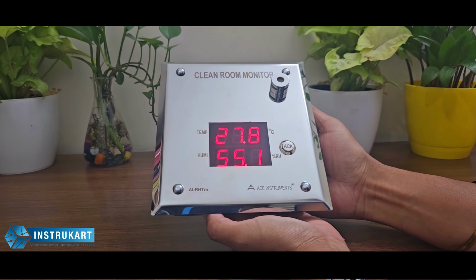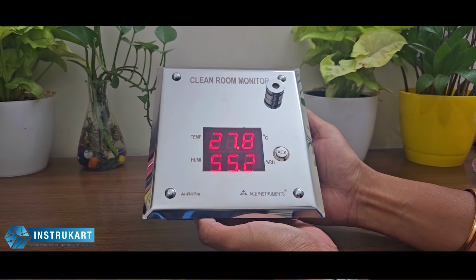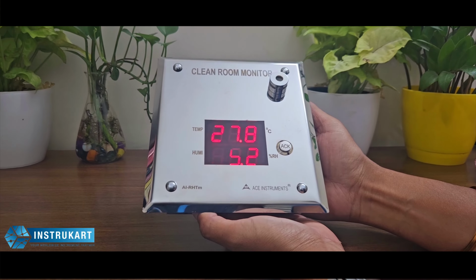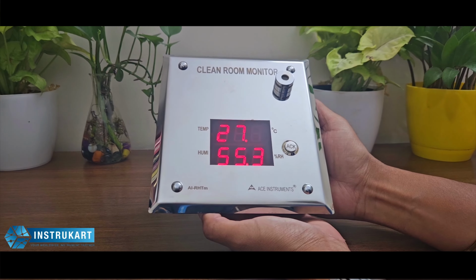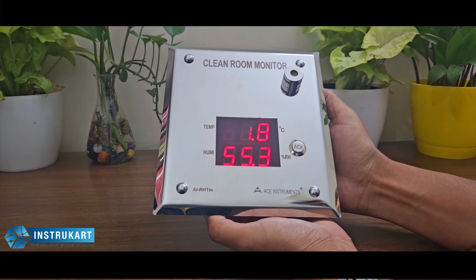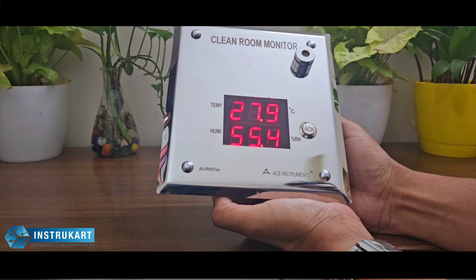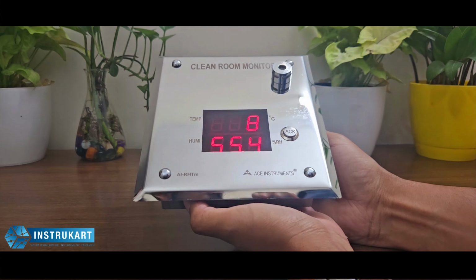We have got a clean room monitoring device which monitors temperature and humidity in a clean room, HVAC, hospital OTs, and places where the environment is critical and to be measured, especially in temperature and humidity parameters. So this is for temperature and humidity. As you can see, this is the LED. We do have the LCD version and the TFT version should it be required by the user as per their setup.